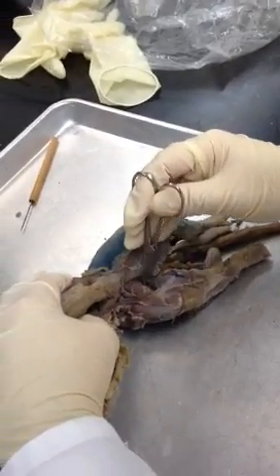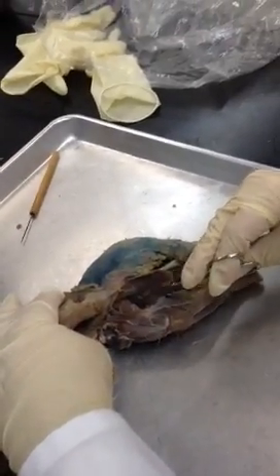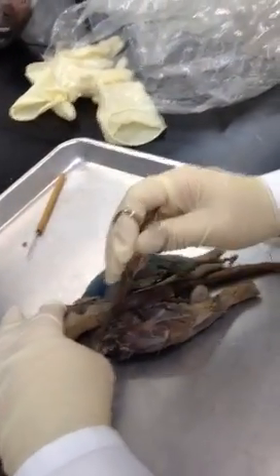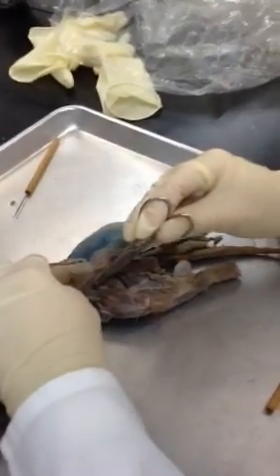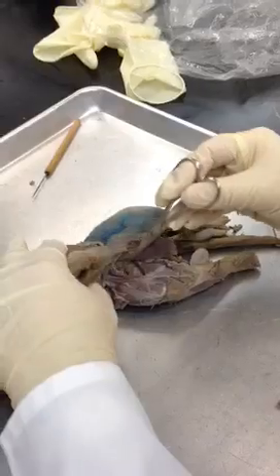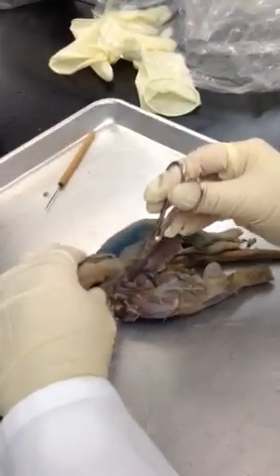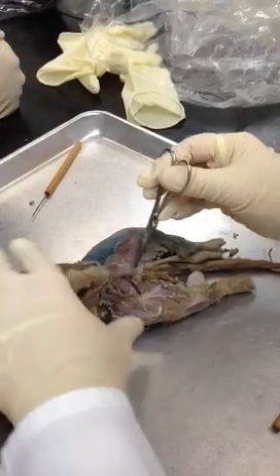In between these two, way down in there, is where you find brevis — way in there somewhere. That's why you can't see it. Or up here you can also see it, but it's very deep in the other muscles. And way up here is a nice artery and vein — that's really where psoas would be. So again: adductor longus, adductor femoris, semimembranosus, semitendinosus right in there.